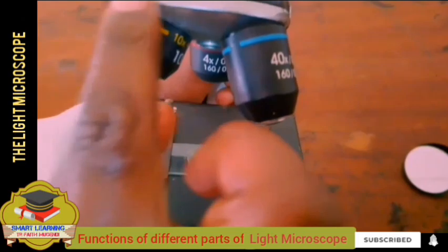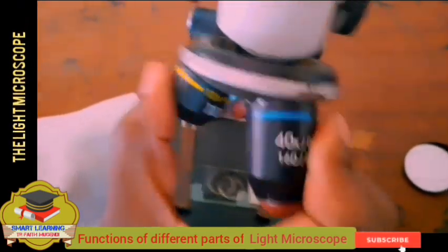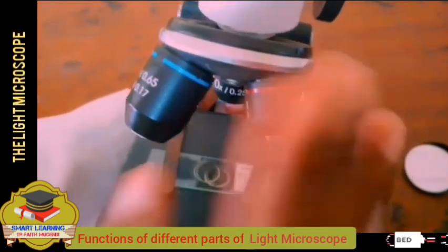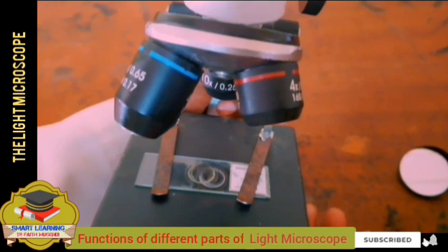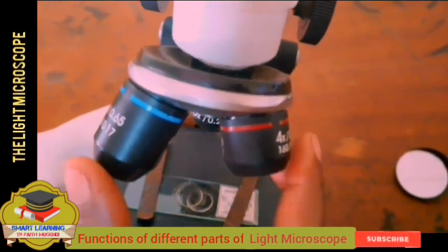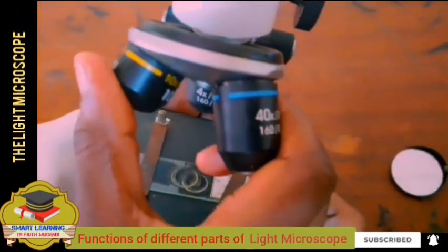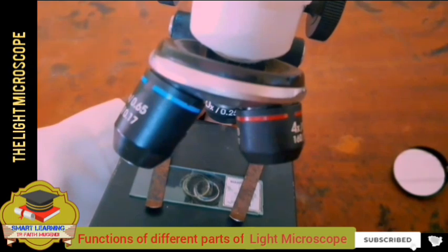That's why we say the nose piece is rotatable. We can rotate it so that we can select the type of objective we want to use, whether high, low, or medium objective lens, just like that.